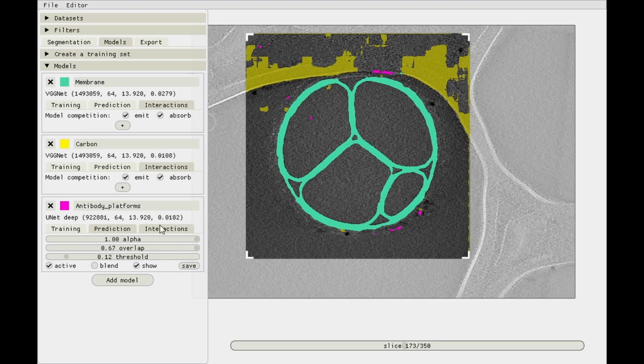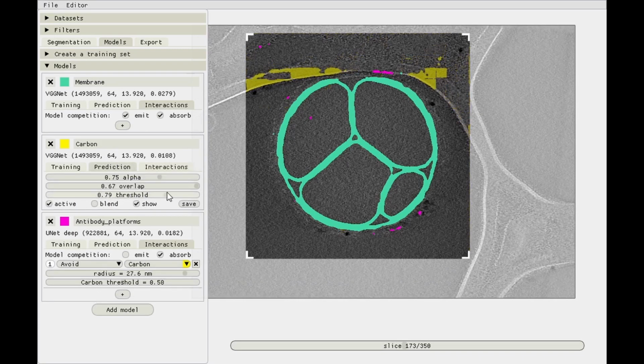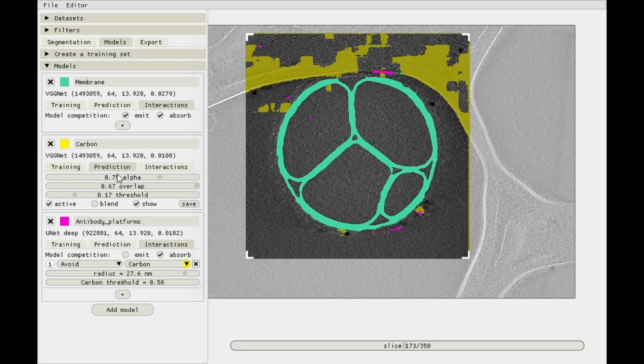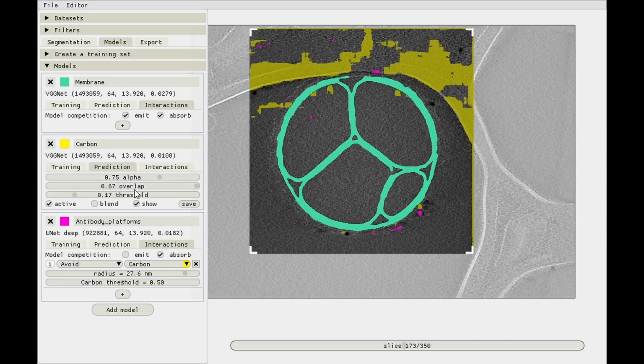And one way to fix this is to go back into that interactions tab and say that the threshold for the carbon model in this carbon avoidance interaction must be lower. So you can play around with the threshold for the carbon model. And I'm not too happy with the carbon model, so we should have probably just trained it for longer, or maybe included some more negative examples for the membranes, or annotate this more thoroughly. But it is what it is right now. So with a threshold of, let's see, 0.35, this is alright. Well, this is not great, but it's reasonably useful for a model interaction. And there's no carbon being predicted over here, so we don't need to worry about losing these two for correct predictions. So a threshold of 0.35 is fine.